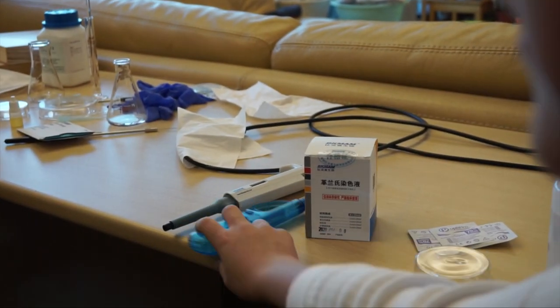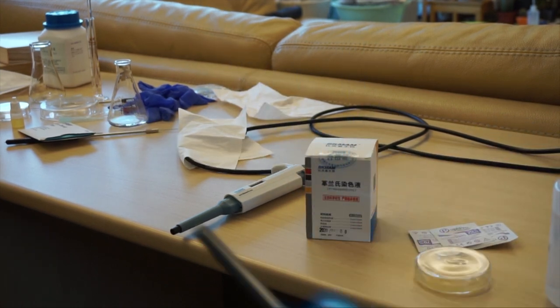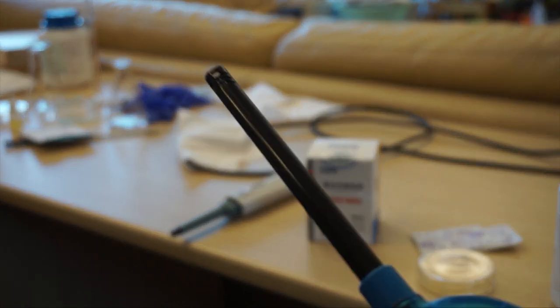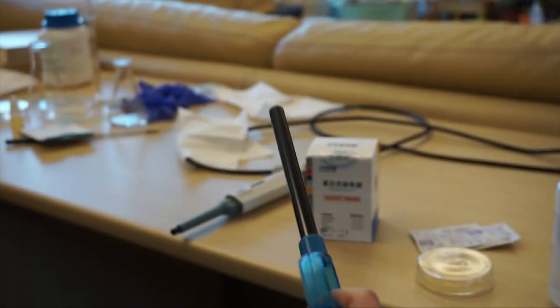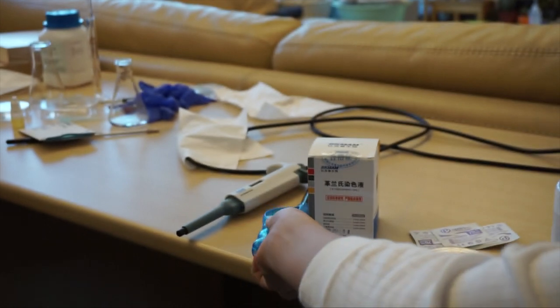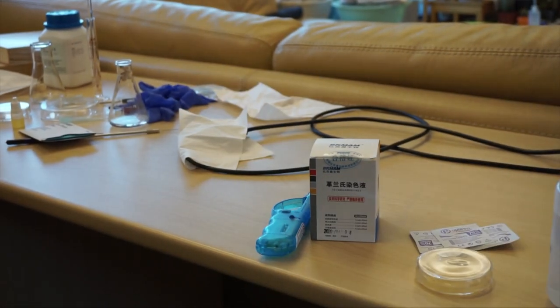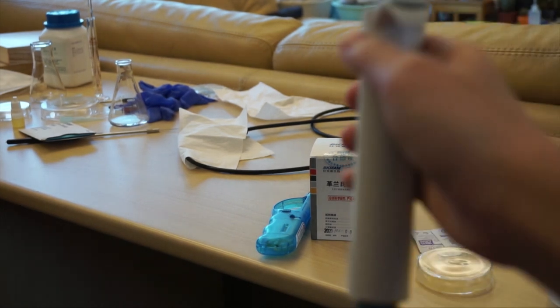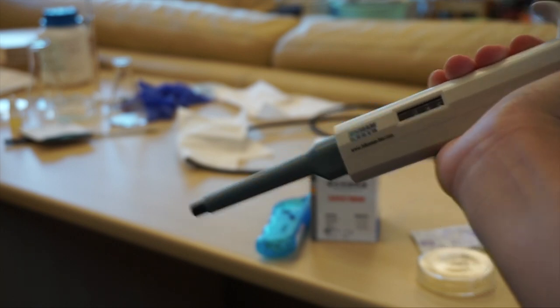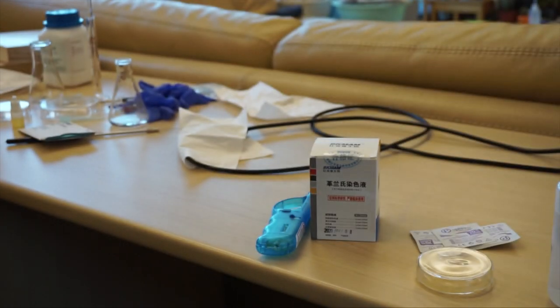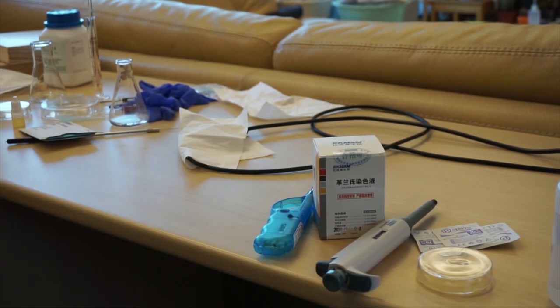A gas lighter. We usually use a Bunsen burner but at this environment we don't have a Bunsen burner available, so we will use a gas lighter. And a pipette. You don't have to use micropipettes but I prefer them. They're more accurate. So let's start the procedure.